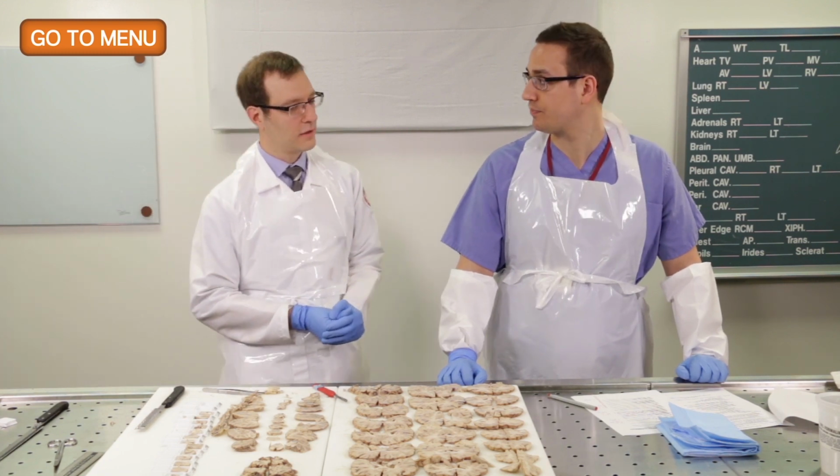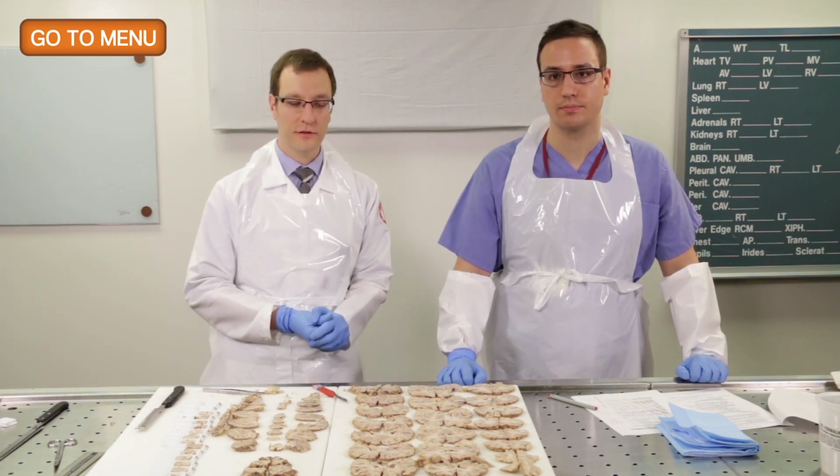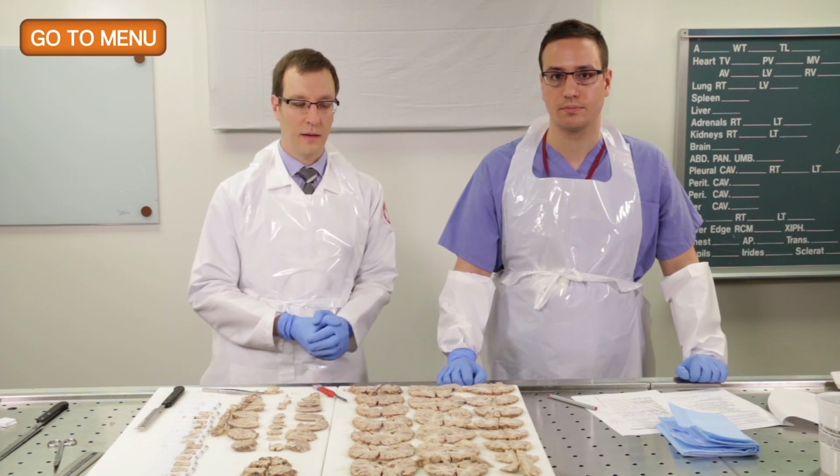I don't think so. Okay. Well, thank you very much. It was a pleasure to demonstrate a brain cutting session.